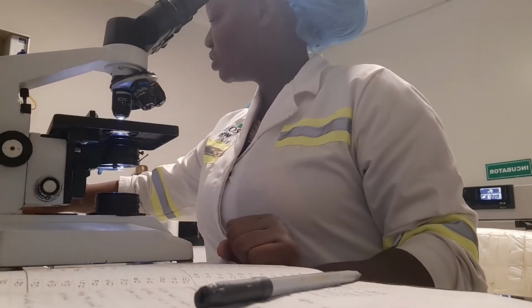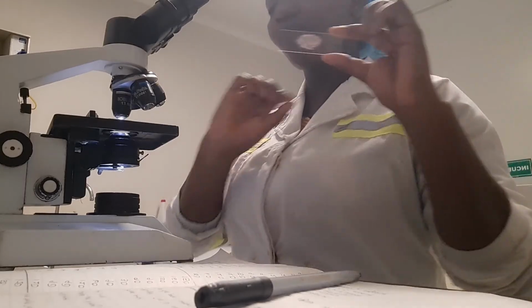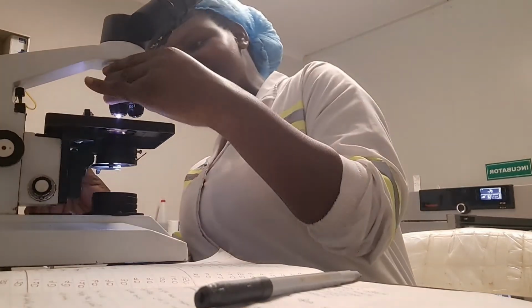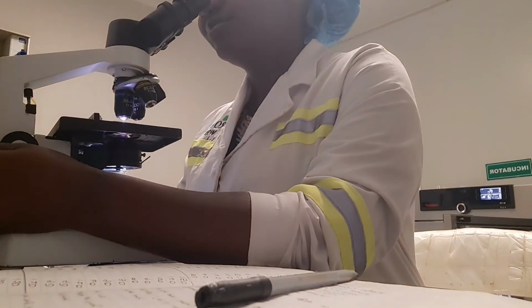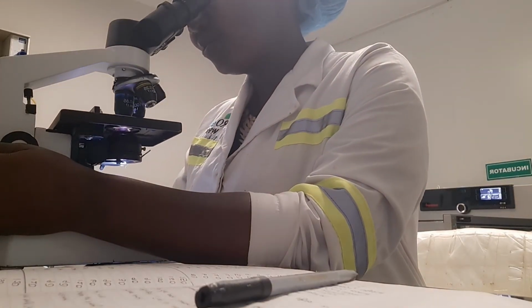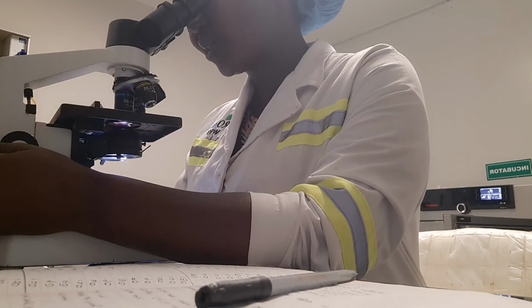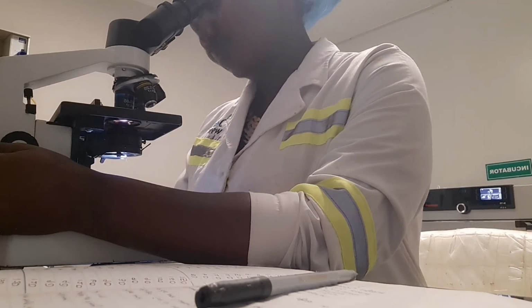Okay guys, so now we're basically done with the actual gram staining. Now we just want to view the slides, so we're using a microscope. So basically now we're just trying to find what we see on the microscope. Either you're going to have cocci or rods, and they're either going to be purple or they're going to be pink. So you just identify what you see and then you write it down, and then you can research on what you think it is. As simple and straightforward as that.